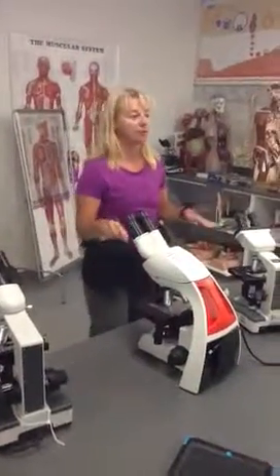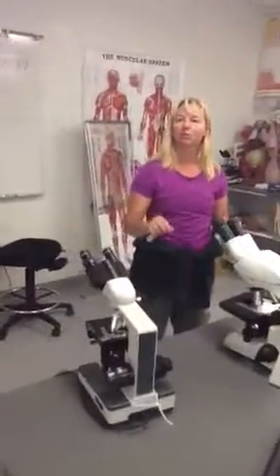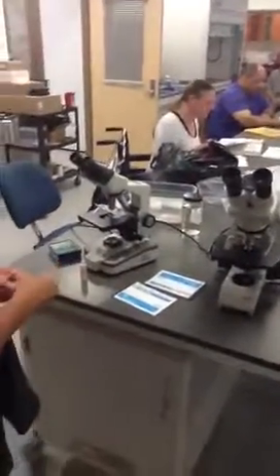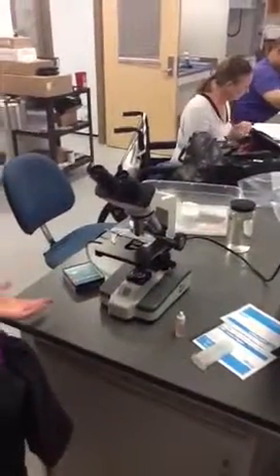We use all three different microscopes. If you are not familiar with how to find things on the microscope, you'll probably want to come over and watch this. Please don't stand in front of Andre because he's going to be filming it so I can put this up for reference. All of our microscopes here are electric and we have three different types that you'll find in our lab right now.